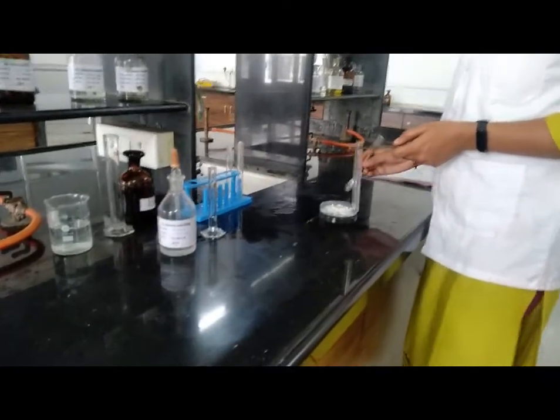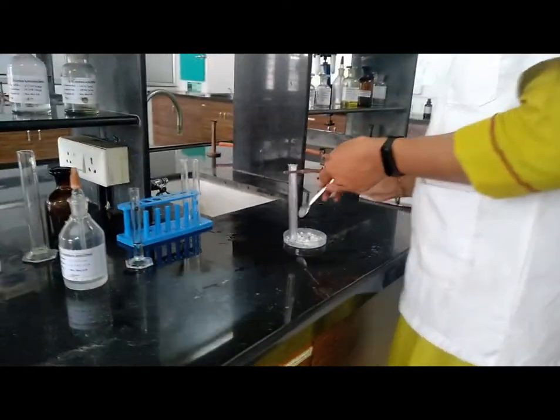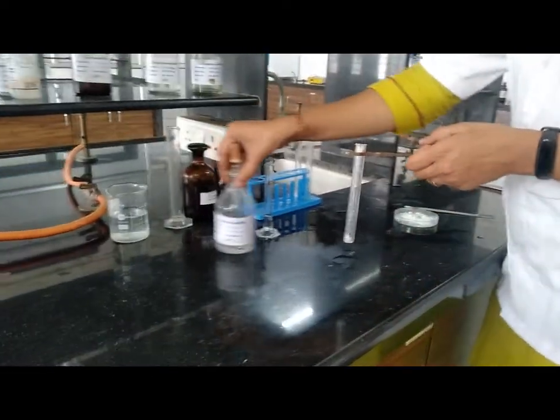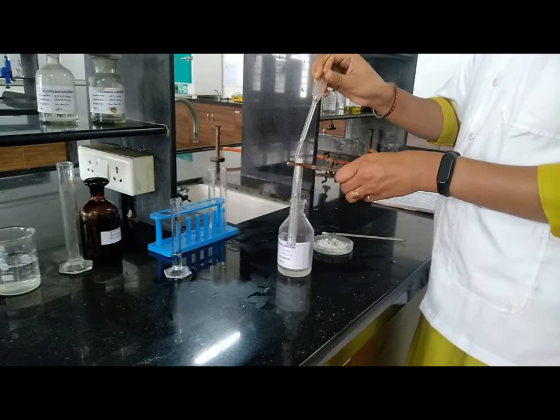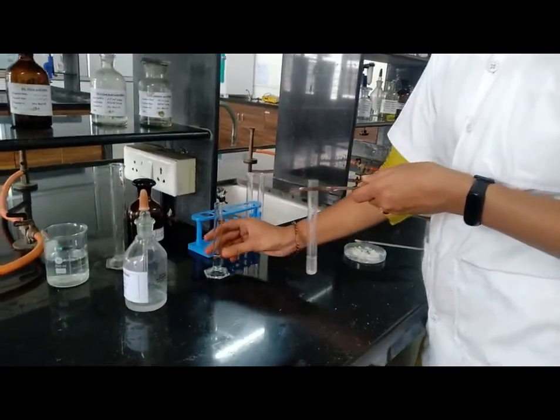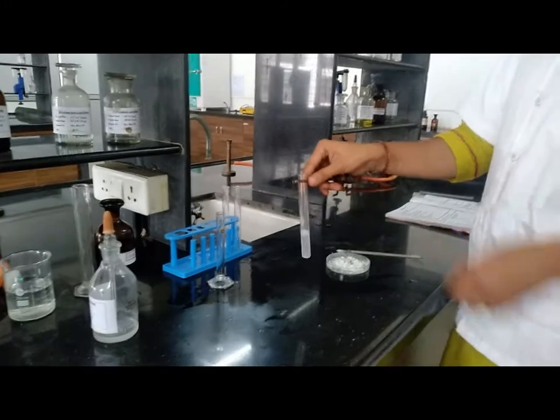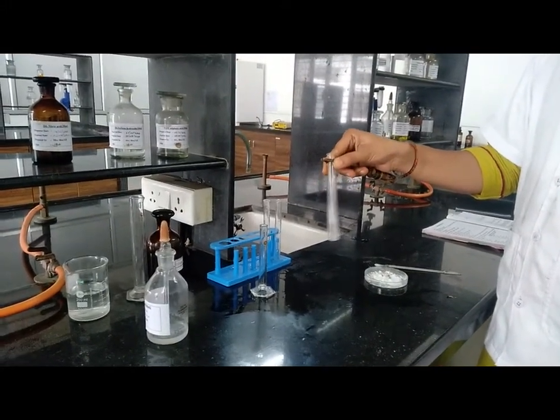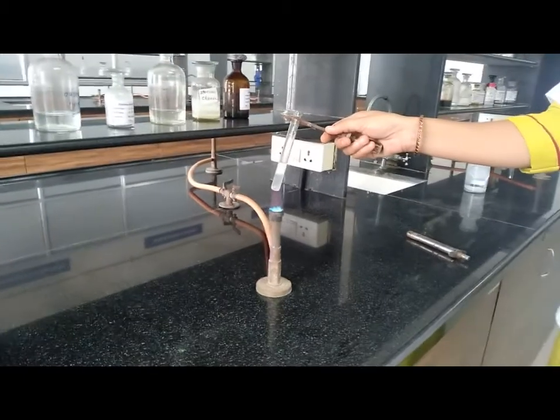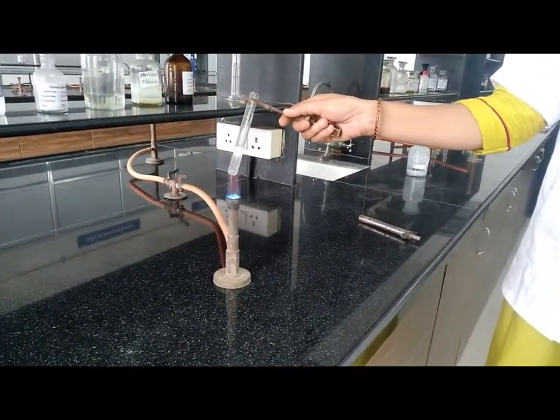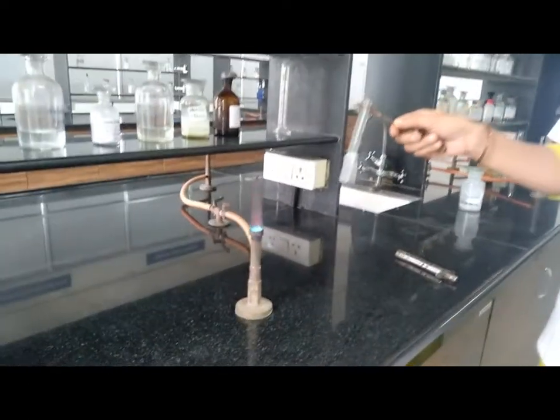Next test: take 1 gram of salt. Now we have to heat this solution on burner and check its gas. On heating, acetate odor is evolved.